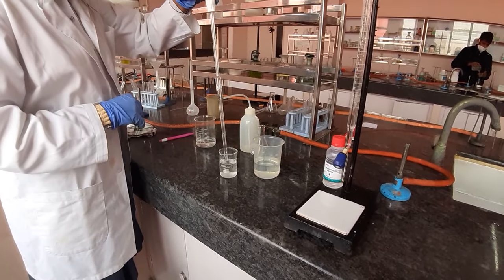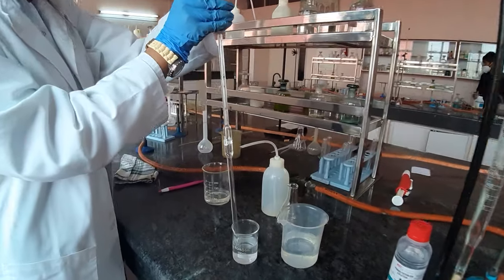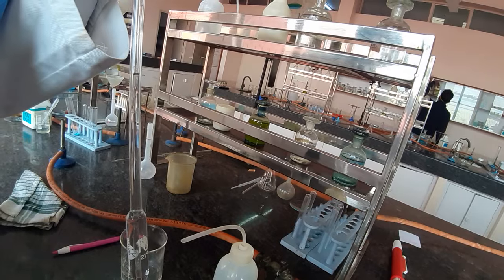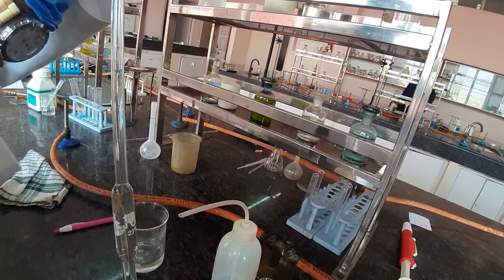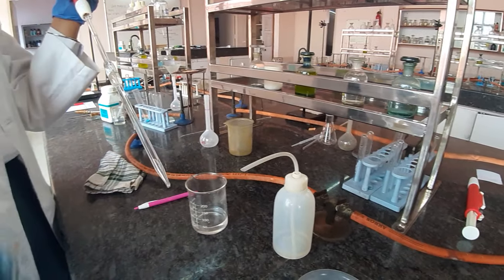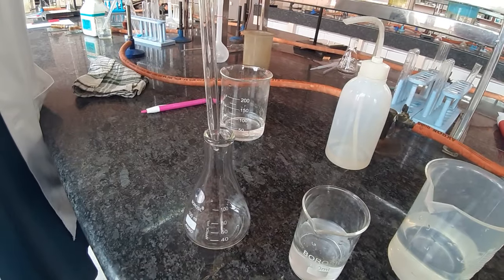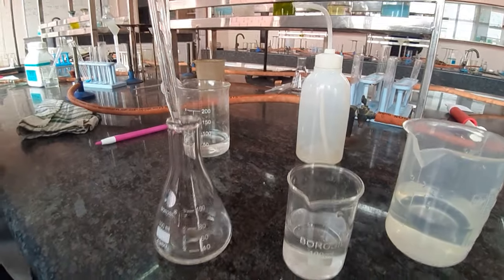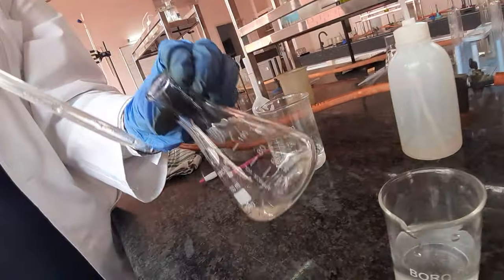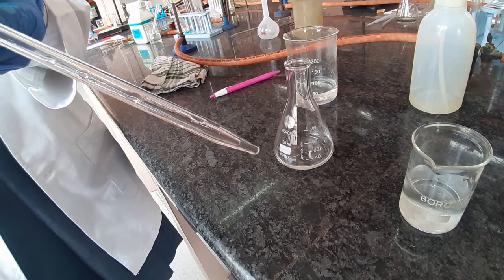You will now measure 10 ml of oxalic acid for your titration through the pipette via this pump. The suction pump will help you take 10 ml of oxalic acid into the pipette. Take it above the mark and then adjust it through the knob down to the cut mark. She has adjusted it to the cut mark and now she will introduce this into the conical flask by pressing the push button, transferring the total 10 ml of oxalic acid. Tap the pipette twice onto the surface of the titration flask. The small volume remaining in the tip is an adjusted volume — please ignore it and do not blow it off.